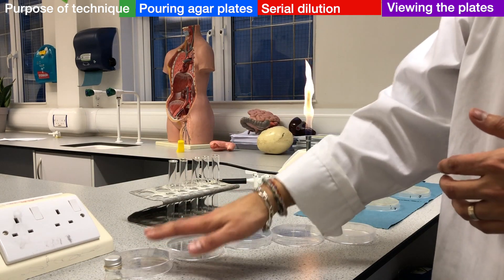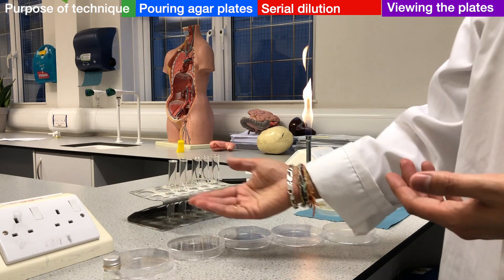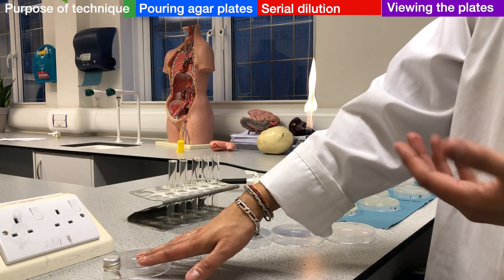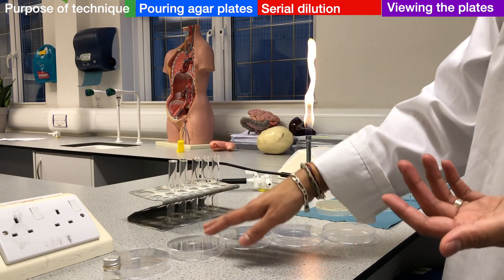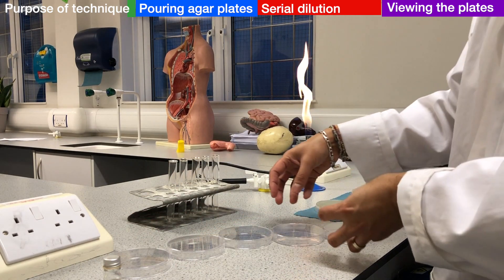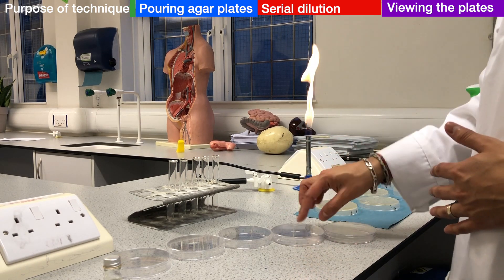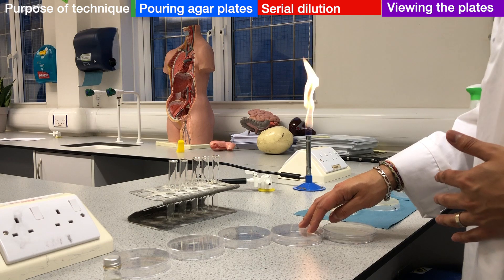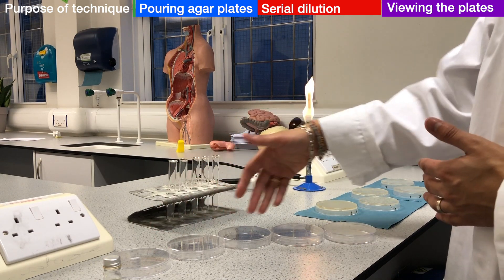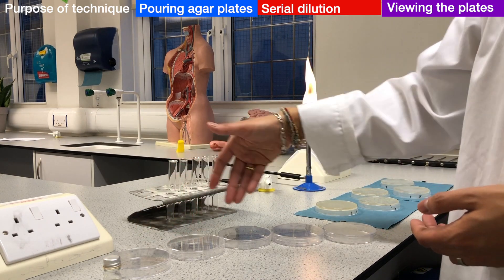Because we don't know how dense the culture is, the first dilution may be too dense for us to count the colonies. We may have to dilute it a few times before we get the separation of individual cells to the level where we can count individual colonies. Because we don't know the dilution necessary to reach that point, we have to do a serial dilution.